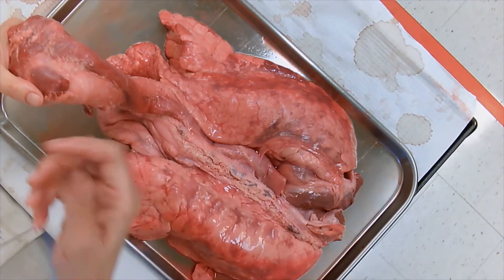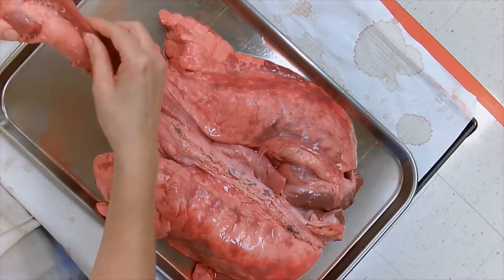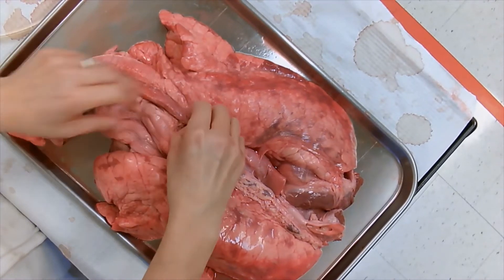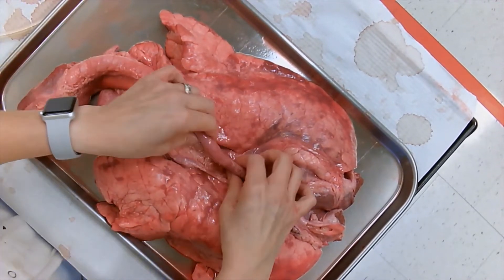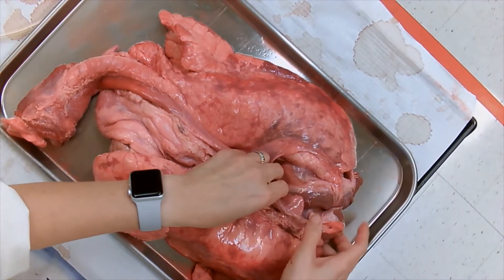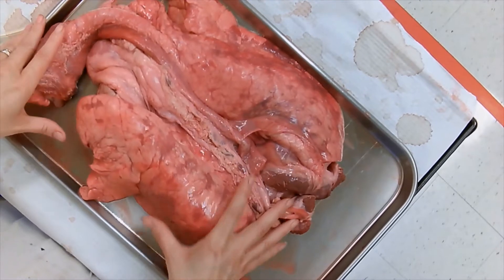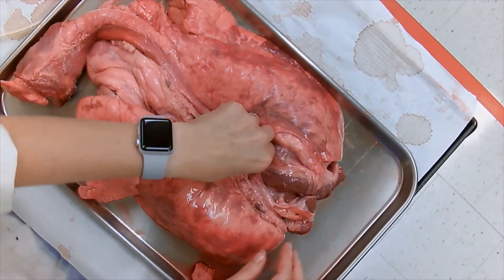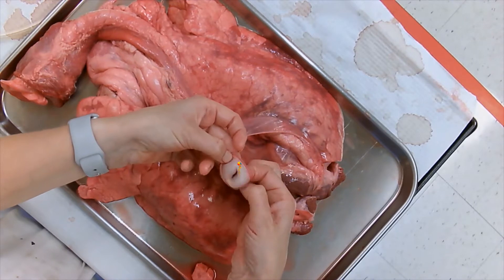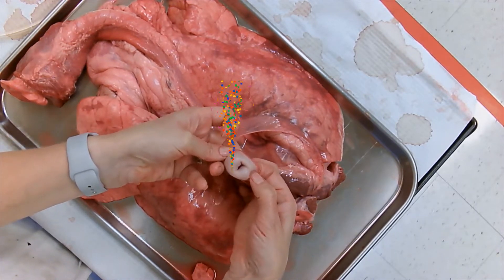It's like when you're taking the toothpaste out of the toothpaste tube and you press — it's the same thing, the food is pushed down. Of course since this is only the upper respiratory tract, the digestive system is cut off here, and you can see the other end of the esophagus and the nice inside of it.